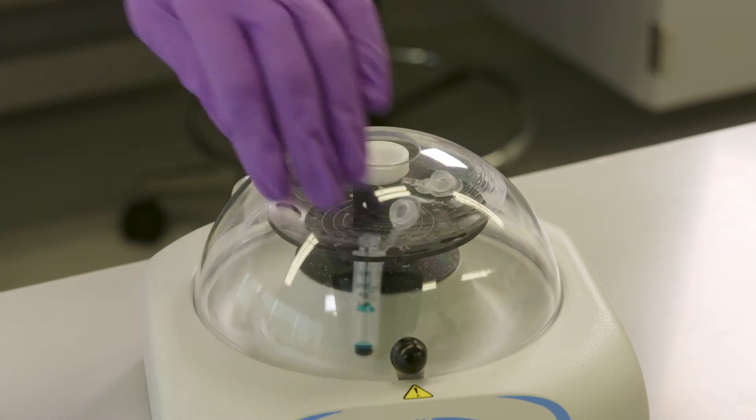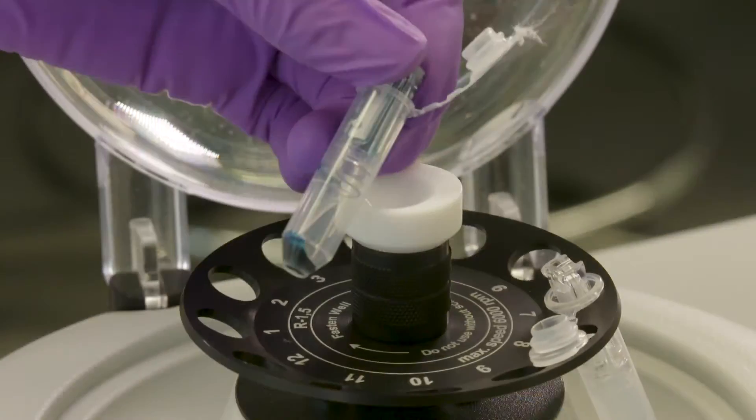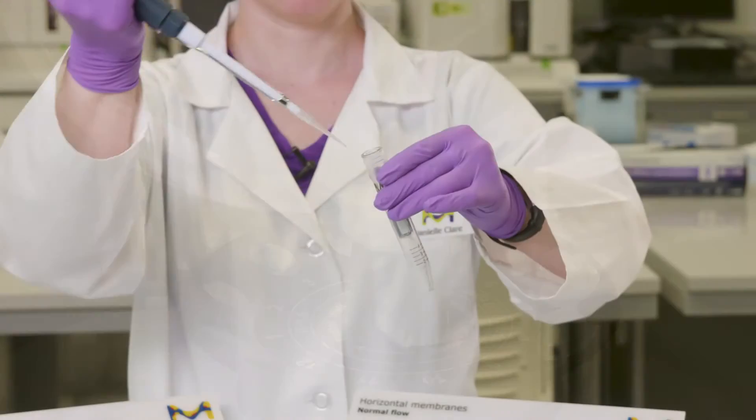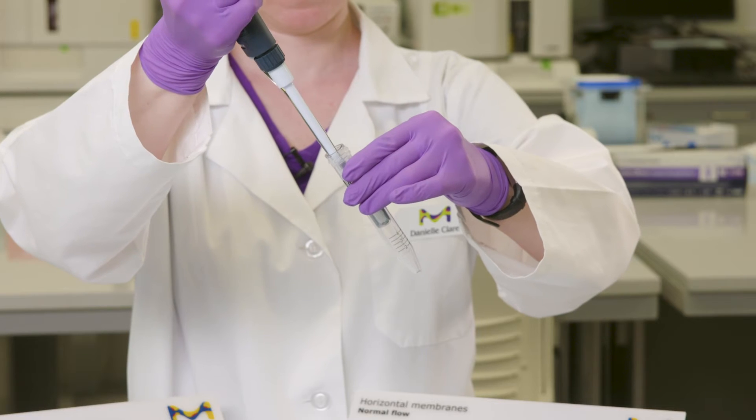The reverse spin technique not only recovers all of the residual volume from the concentrator, it also eliminates the need for handling the sample with the pipette tip that can lead to additional losses.